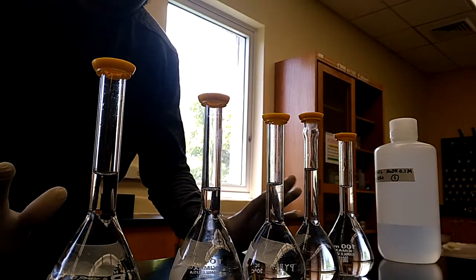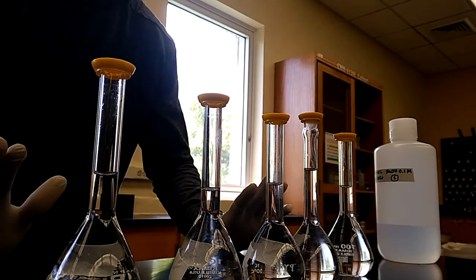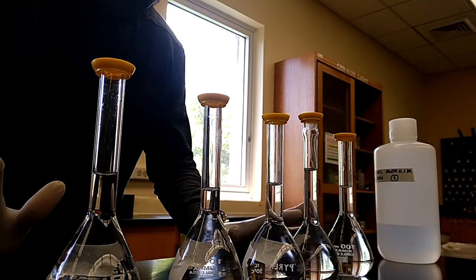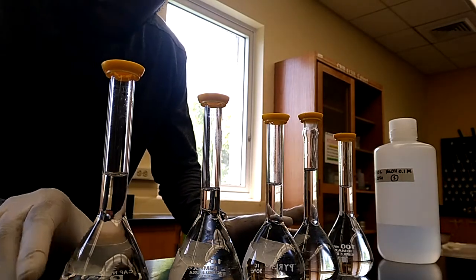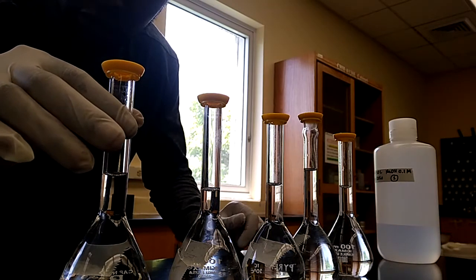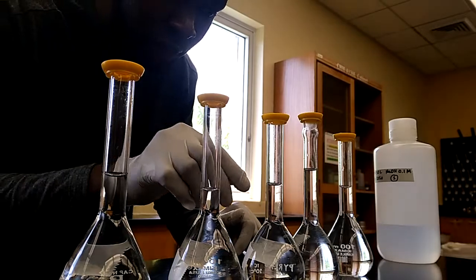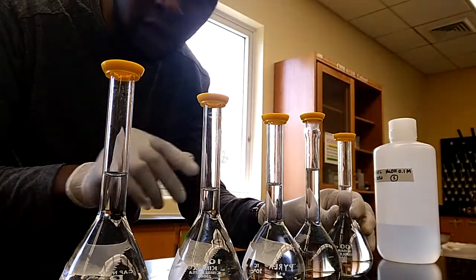Now I have prepared the calibration standards, so the next thing is to prepare the commercial tablet. Each of these calibration standards contains 1 ml of the stock solution, 2 ml, 3 ml, 4 ml, and 5 ml respectively.